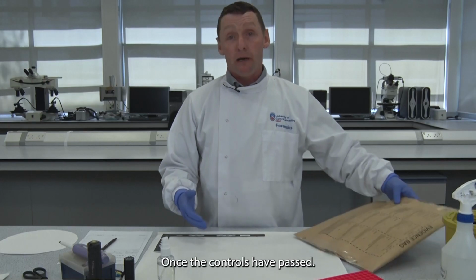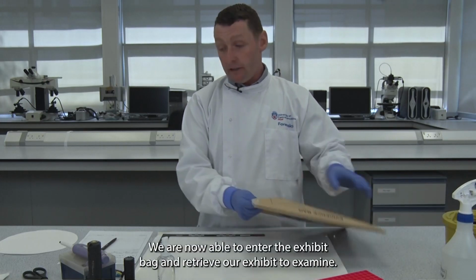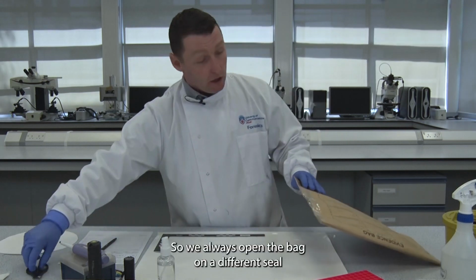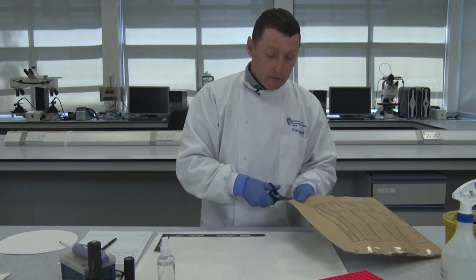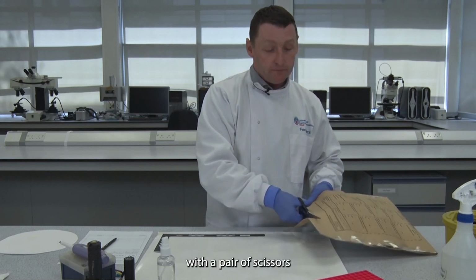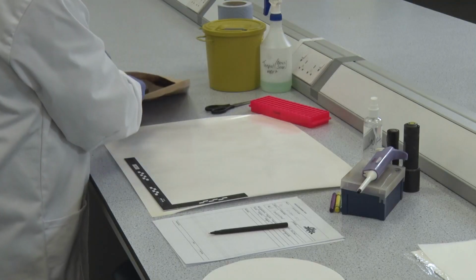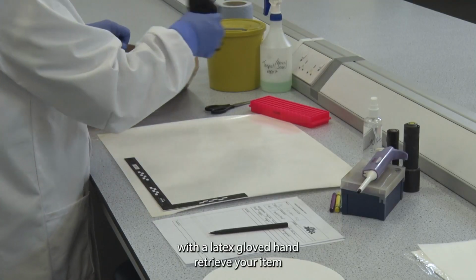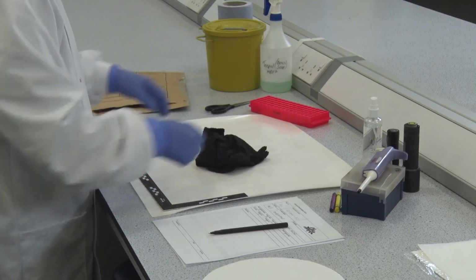Once our controls have passed, we're now able to enter the exhibit bag and retrieve our exhibit to examine. So we always open the bag on a different seal, and we simply cut our exhibit bag with a pair of scissors. And with a latex gloved hand, retrieve your item and place it onto your examination desk.